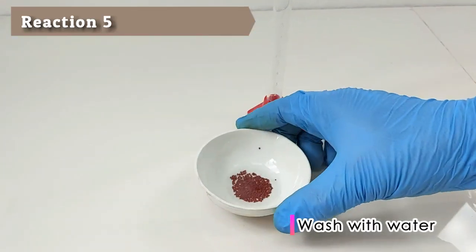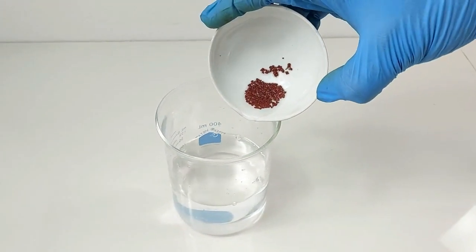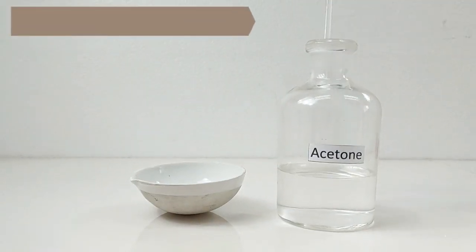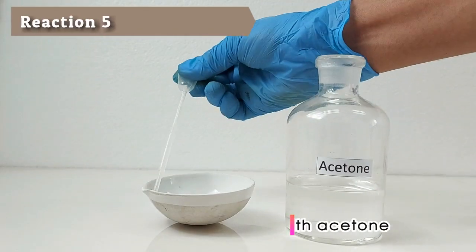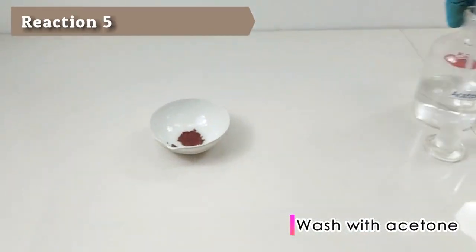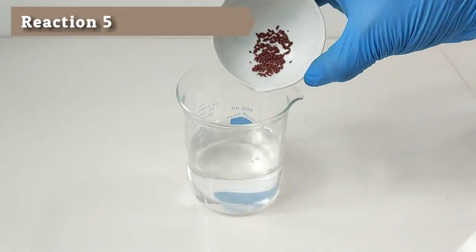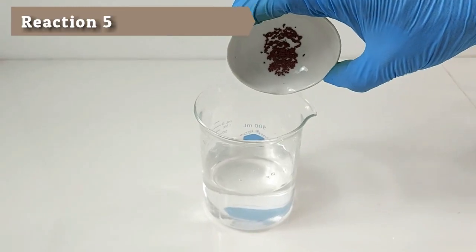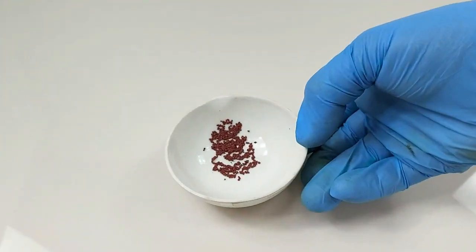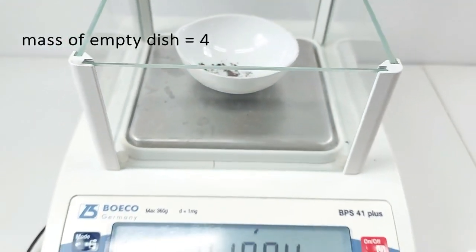Wash the product with about 1 ml of deionized water. Allow it to settle and decant the washed water. Rinse the product with 1 ml acetone and then decant. Dry and weigh the final product.